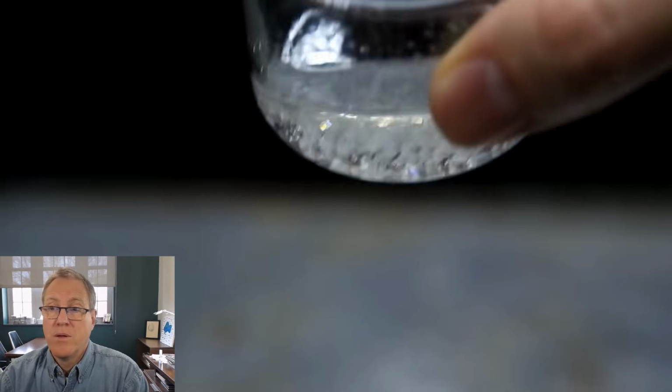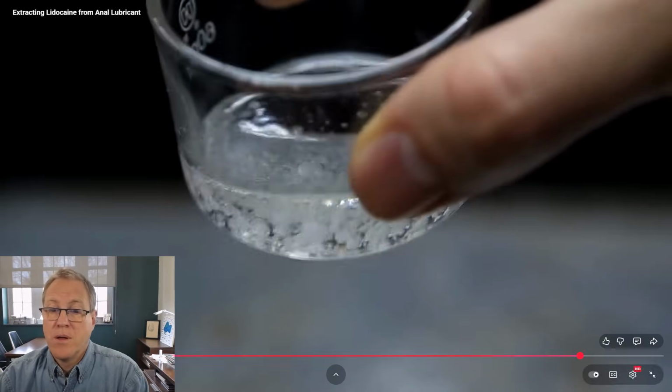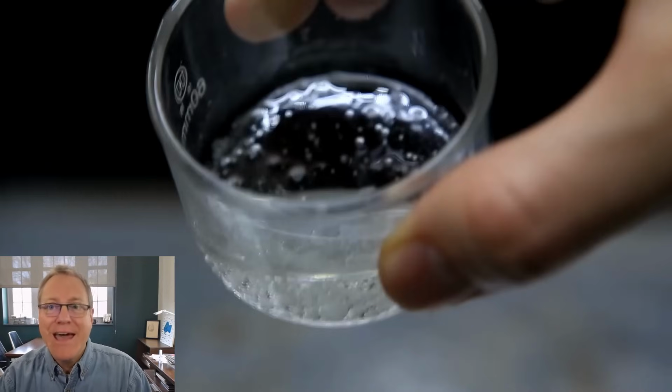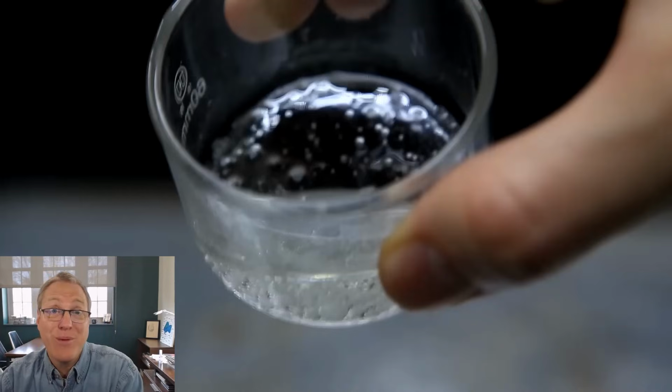It's really important that you just let it dry in air because it has a really low melting point, and if you try to dry it in an oven, something like this will probably happen. Okay, so I said, why wouldn't you heat that up? Because very often you do heat stuff up to drive off water. Well, apparently he did, and he found out that's not a good idea for this. So, that's voice of experience. He tried to do what people often do, and turns out you got to let this air dry.